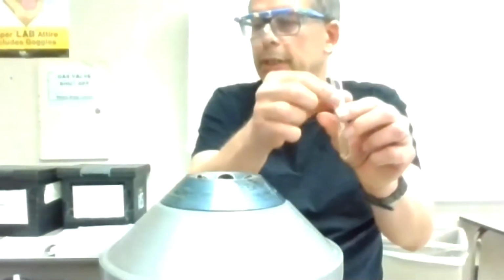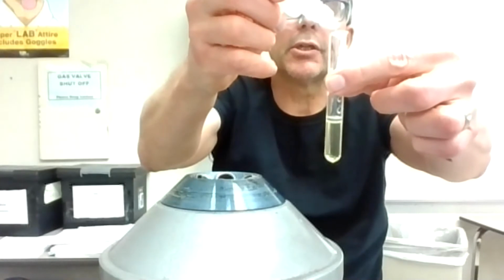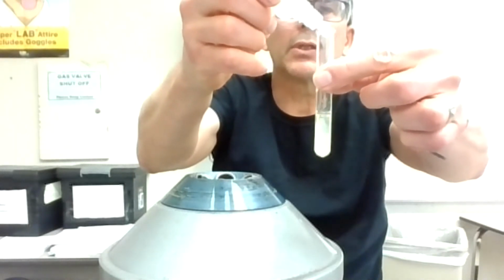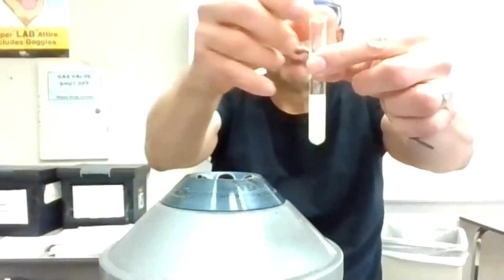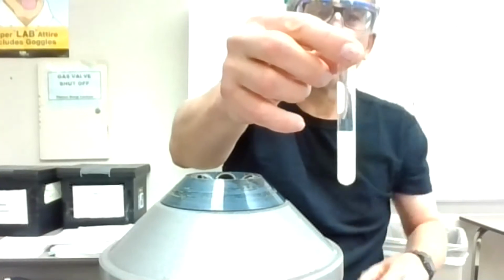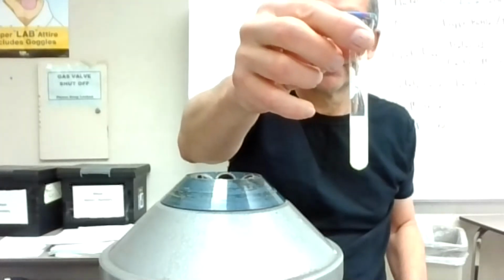Okay, this is the calcium. Now, when I add the CO3, it should become cloudy right away. I'm less worried about the amount of precipitate, but I should see cloudiness right as I add the drops. To me, that looks like it's clouding up. Now, it looks hazy, but right as I added the drops, it was definitely getting cloudy. And if I let this go, if I spin this around, there will be a precipitate formation right there.